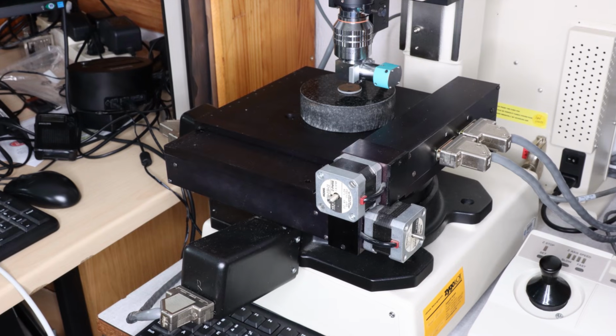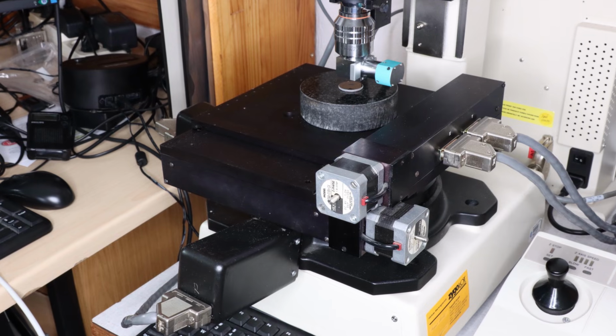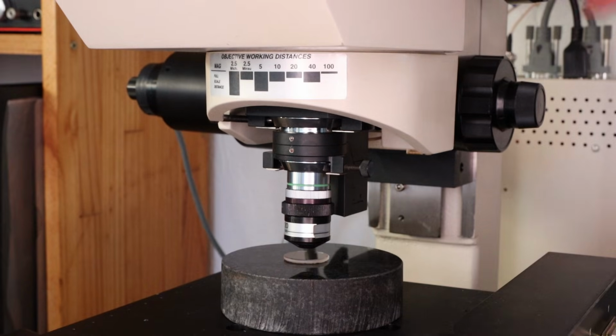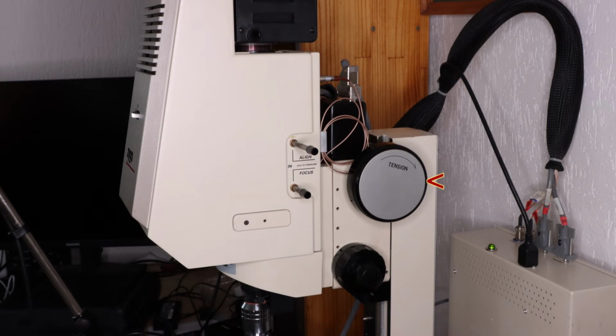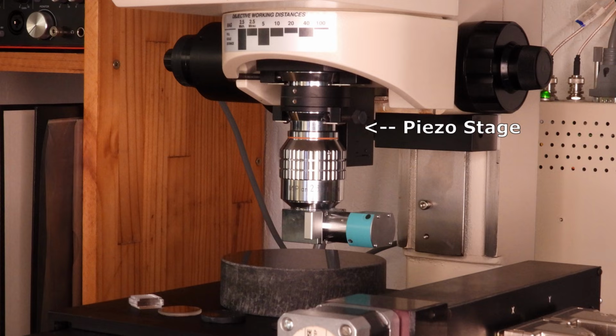Mechanically, it's a fully motorized 5-axis system. It contains a large 4-axis stage for translation and tilt over the X and Y axes. Then there is the 5th axis, which is the translation along the Z axis, so the axis that does the actual scanning perpendicular to the surface. The Z position can be set with different degrees of accuracy. There is the rough height adjustment with this large wheel. Then there is the motorized control that can be adjusted using a remote with different speed settings. And then there is the piezo stage that holds the objective, where we can move the objective over a maximum distance of about 100 microns. And the last one is actually the actuator that does the scanning during the measurements.